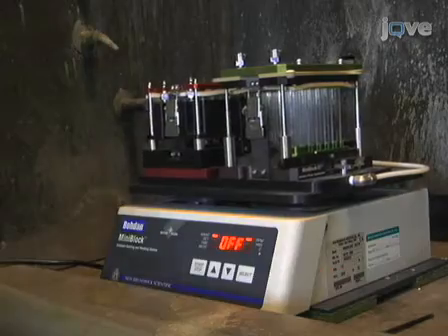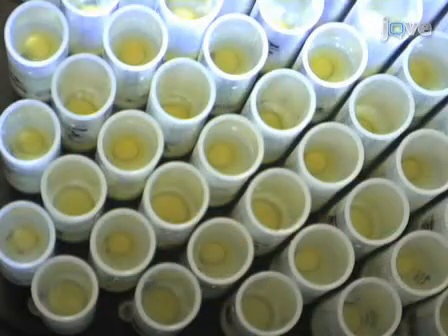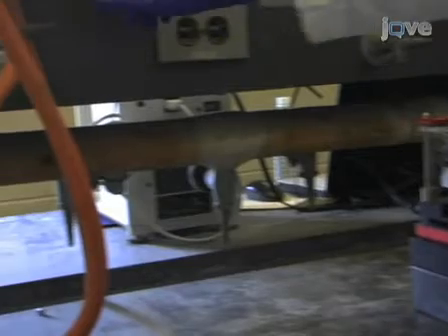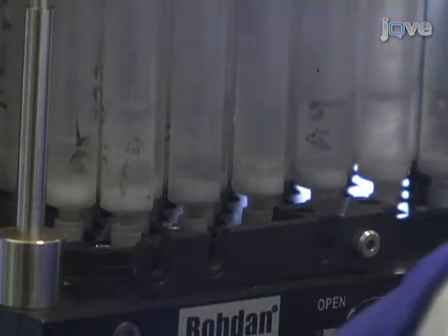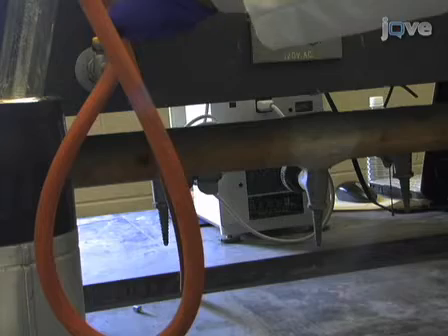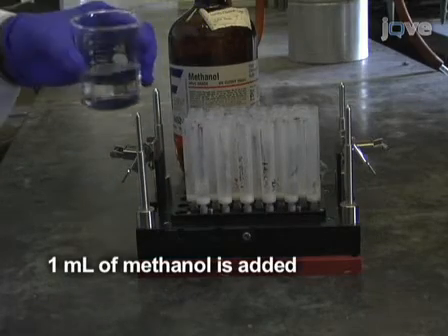After about 16 hours, the MiniBlock is removed from the shaker and you can see that most of the tubes have precipitate. The MiniBlock is now mounted onto a collection base, and the valve is opened for all the filter tubes at once. Vacuum is applied and the precipitate is caught on the filter of each tube. The valve is then closed and 1 milliliter of methanol is added to every tube using a micropipette.